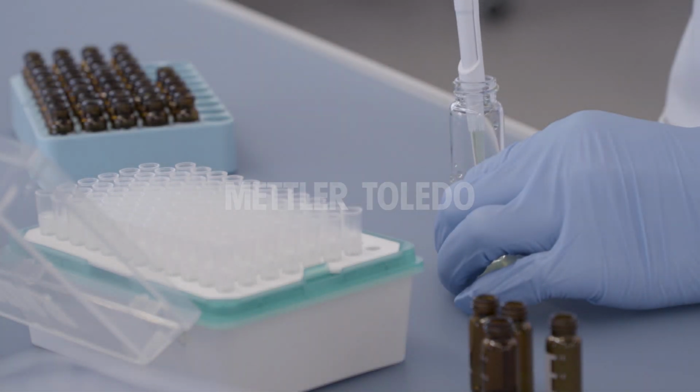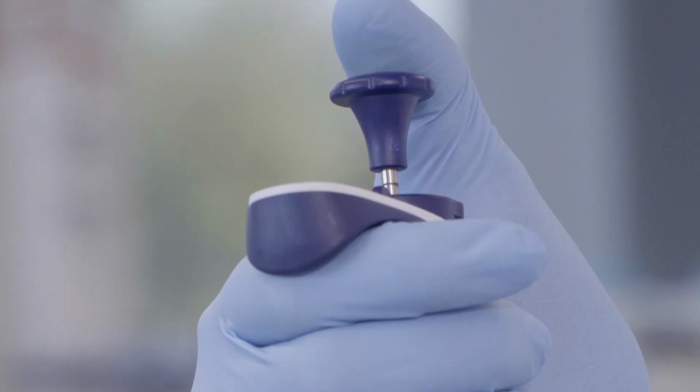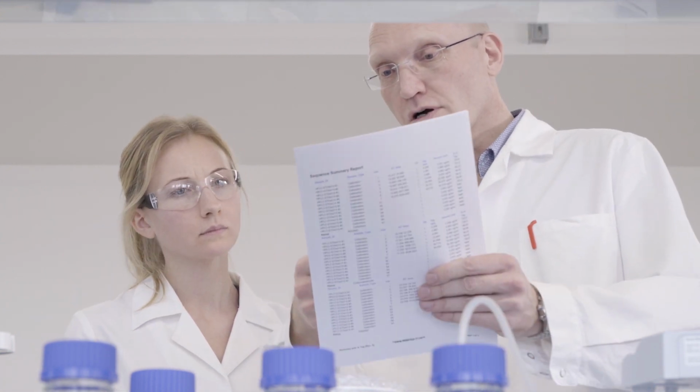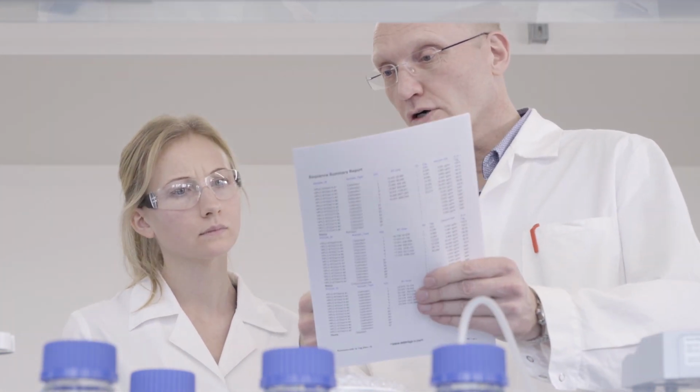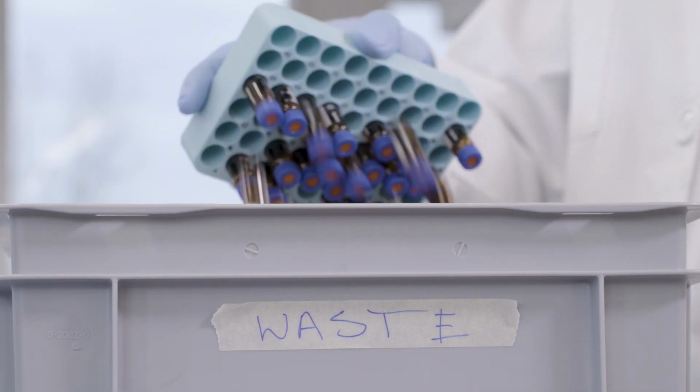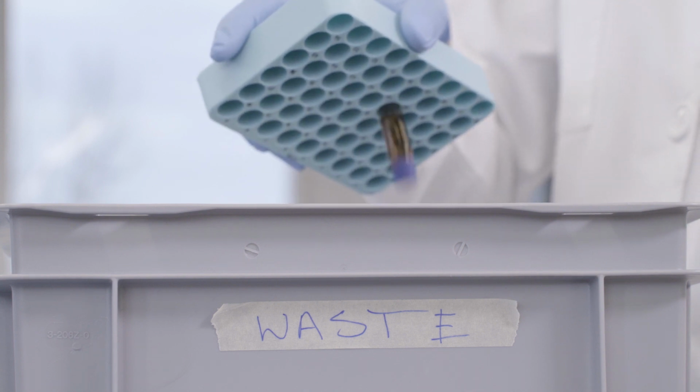Everyday routine work. You rely on your pipette for your experiments and then suddenly the results of your experiments are inconsistent and it may cause a lot of stress. Different kinds of stress. All the work and materials used go to waste and you have to start all over again.